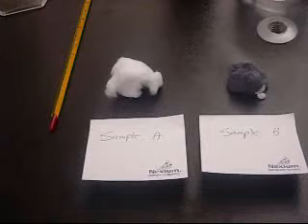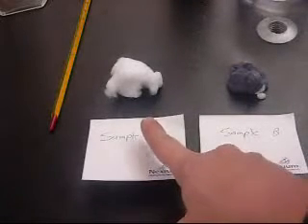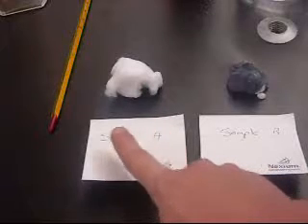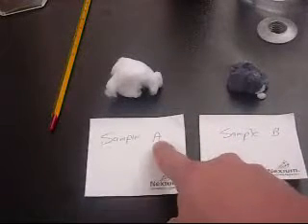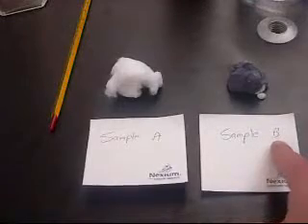So here are the tools and equipment that you're going to be using today for our lint research data sheet. One is you'll be given a sample of 2 different types of lint. You'll actually have 3 different samples of each. You'll have sample and then whatever letter it is, and then a different sample. In this case, I have sample A for my first sample and sample B for my second sample.